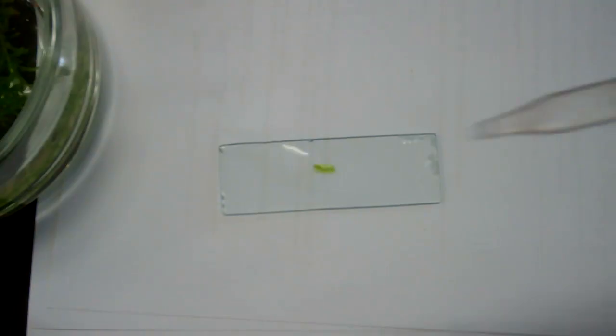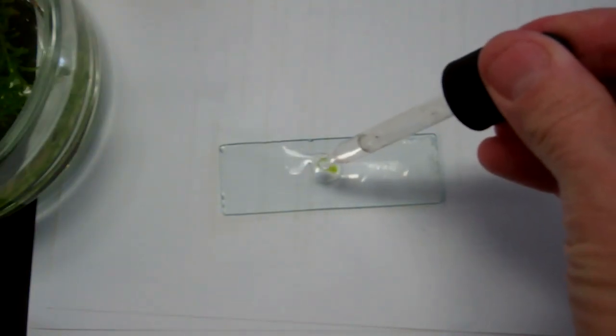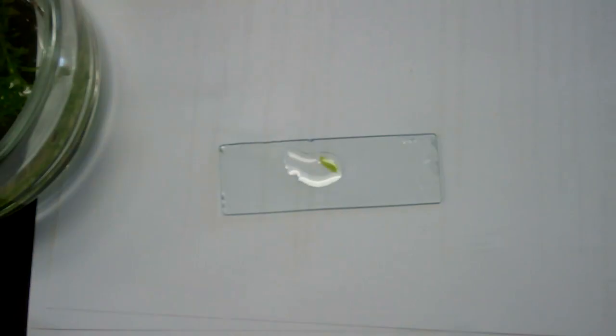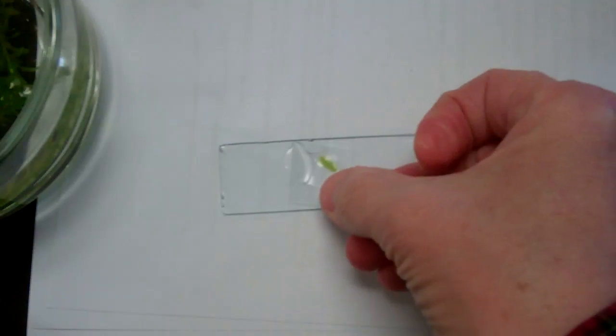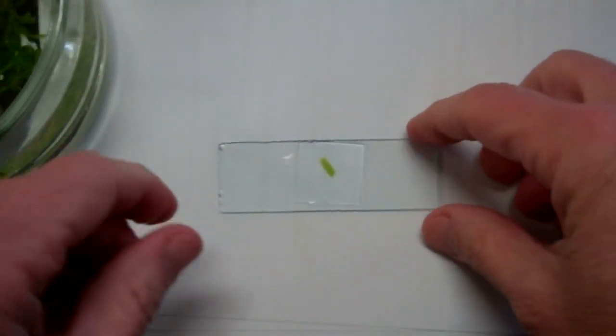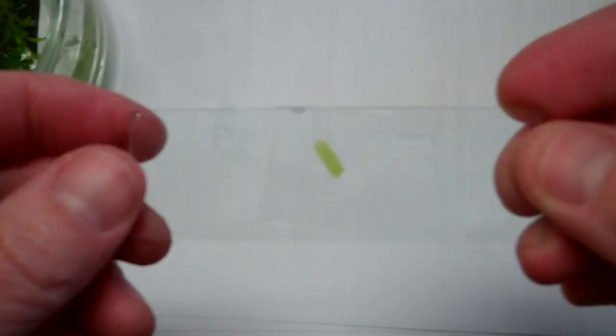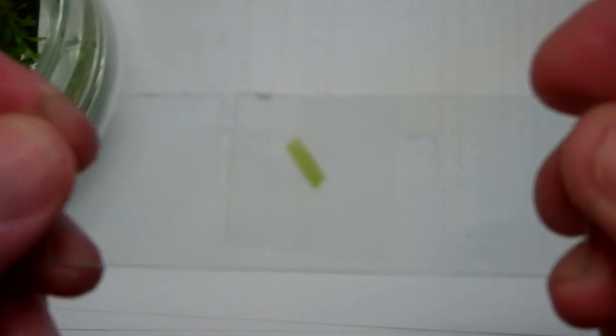This is fresh water, so this is water that this Elodea plant likes. It's used to this kind of water. Here we go, and we're going to put it under the microscope and view it.